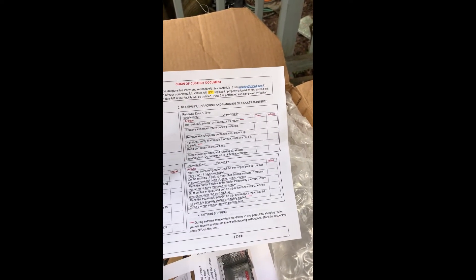Next, there's the content sheet of what's in the test, and it also allows you to initial each activity and use this for your return shipping. This is where you denote which employee is doing the test, and then you send this back with the shipping so that they can analyze your results and give you the answers.